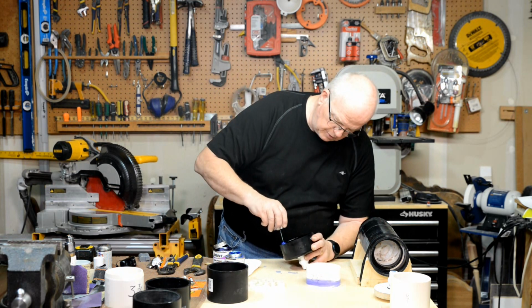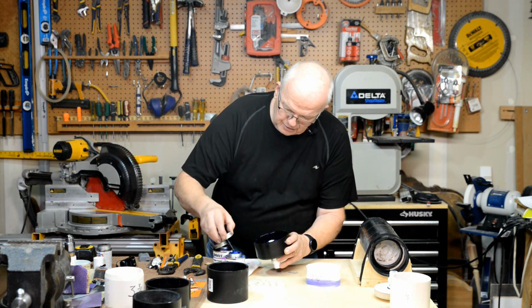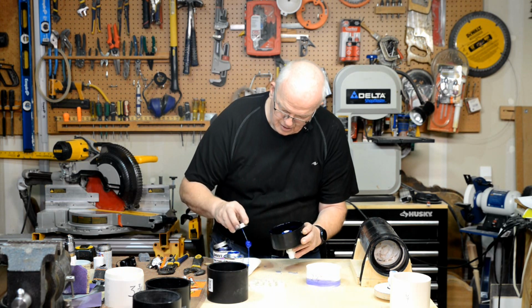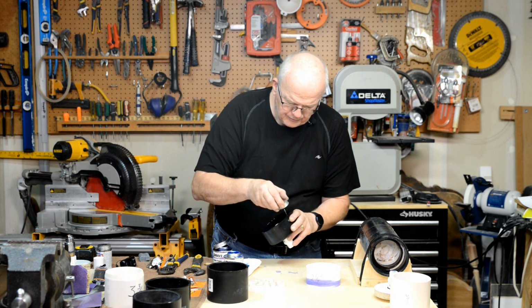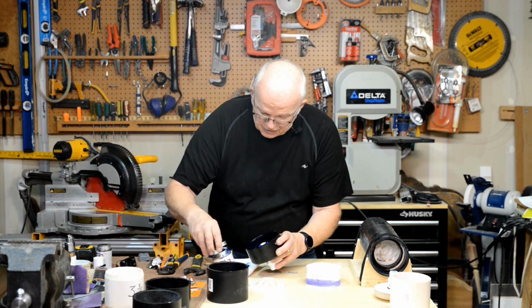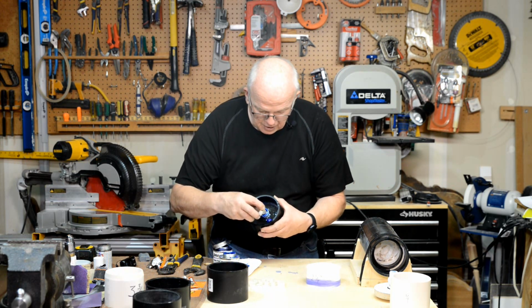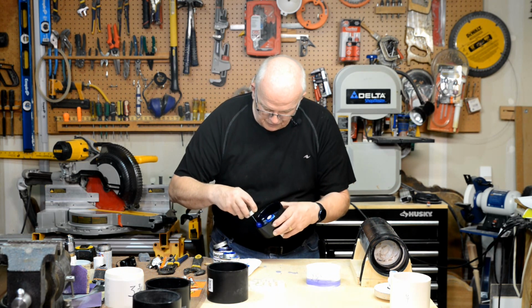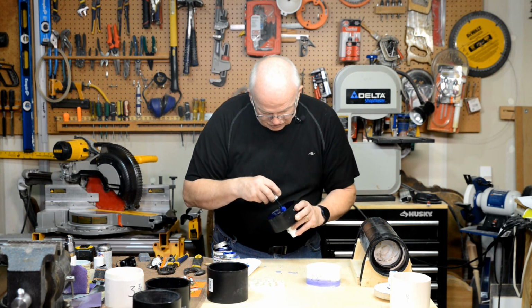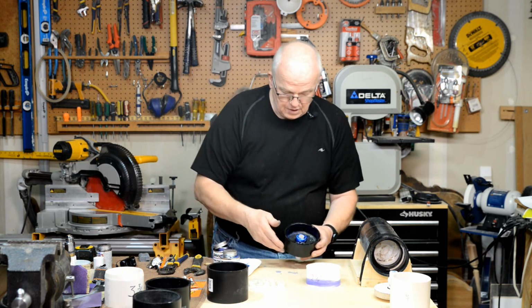So with that, I'm going to put my adhesive around here. Take a little bit more. You're going to want a nice generous layer of it in there. Don't be afraid. As long as it's not on that outside piece, it's not going to squeeze out where you don't want it. But you do want a nice heavy bunch in there. Now, a plumber, which I've done some plumbing, will tell you that you don't need this much when you're doing plumbing applications, but you got to remember you're dealing with a vacuum here, and that is a whole nother ball game.